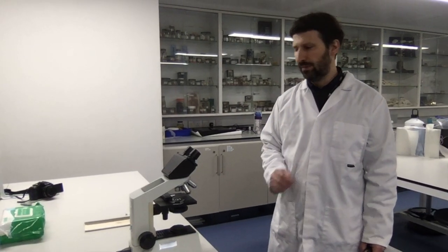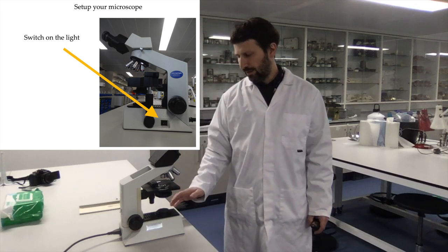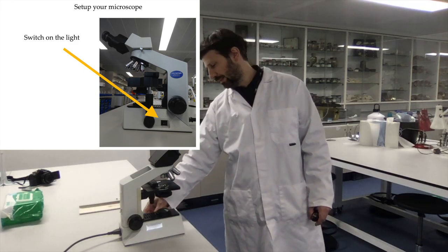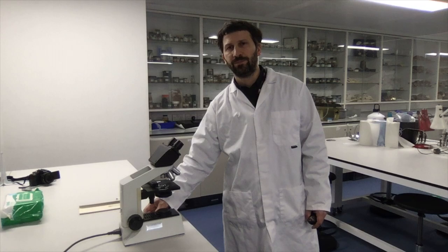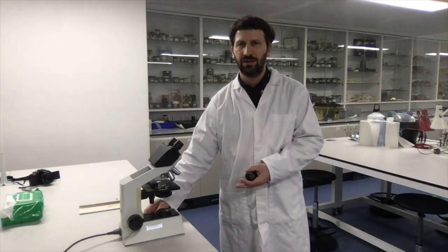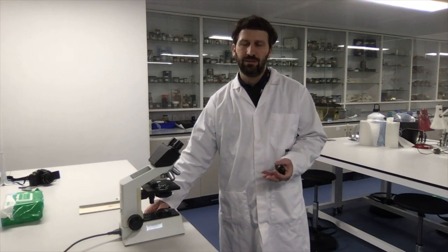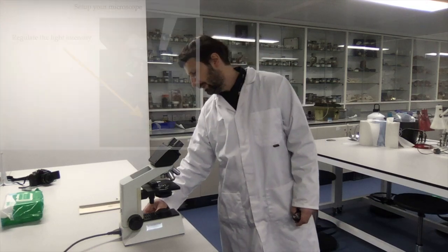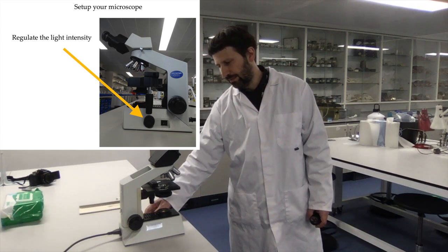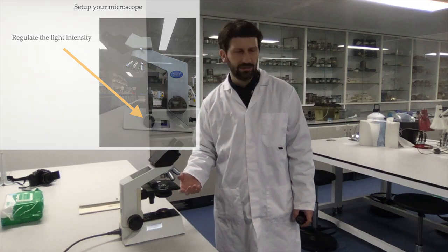The first step is that you switch on the light here with the button. Typically there is almost no light when you switch it on because the intensity of light is set to the minimum, so that when you switch on there isn't a strong shock for the lamp, for the light bulb inside the microscope, making it more likely to be preserved. So you need to increase the light intensity until you are able to see the light. Typically you don't want to have the maximum intensity — just make sure that you can see the light.